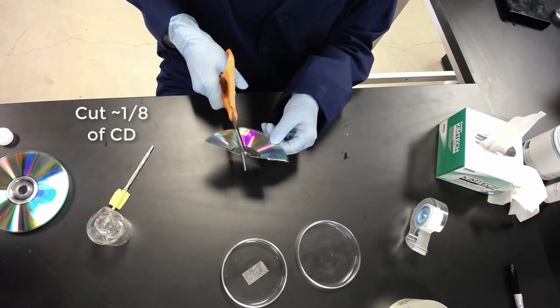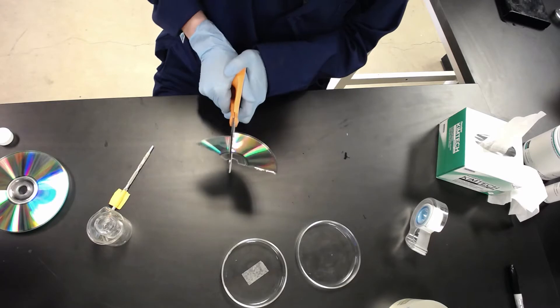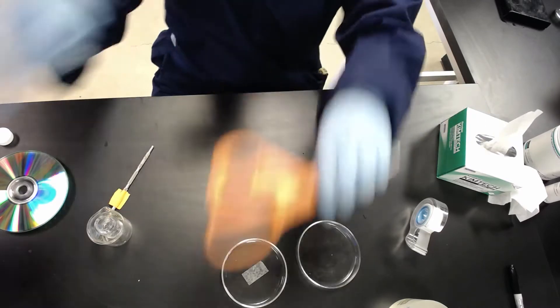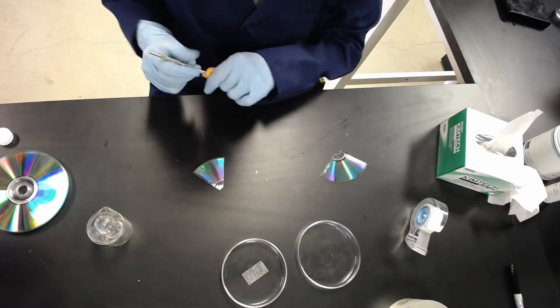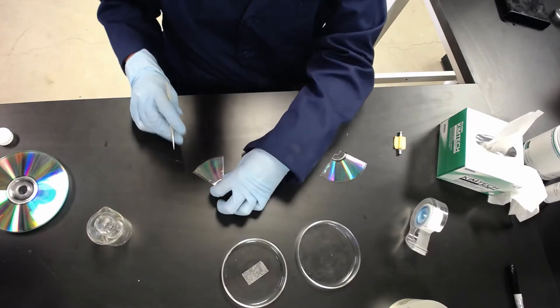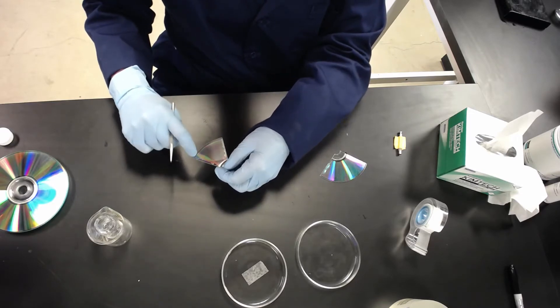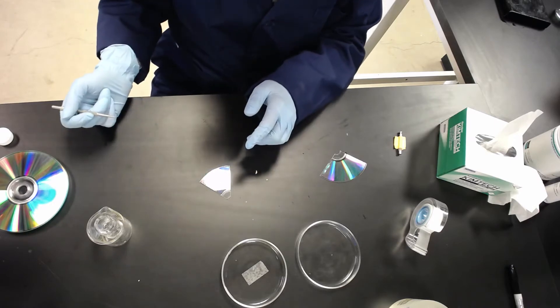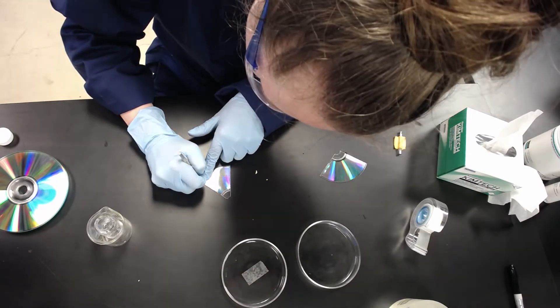Just like this. It's a little hard to cut but it worked. This is why we wear eye protection. Now I'm going to take this carbide pen, and I'm on the shiny side up, which means that this is the polycarbonate, so I'm going to scratch an F backwards.